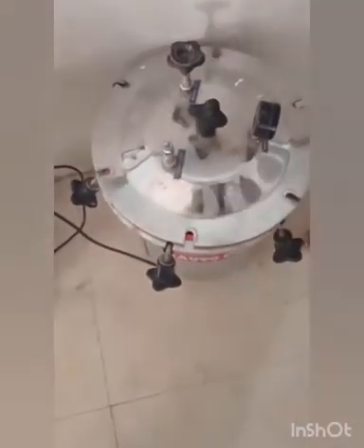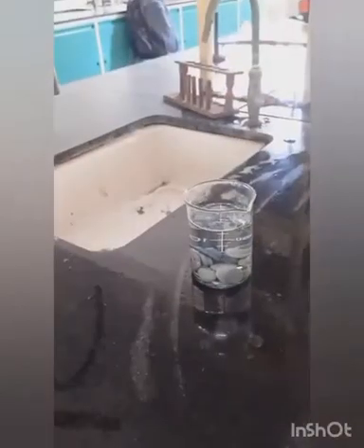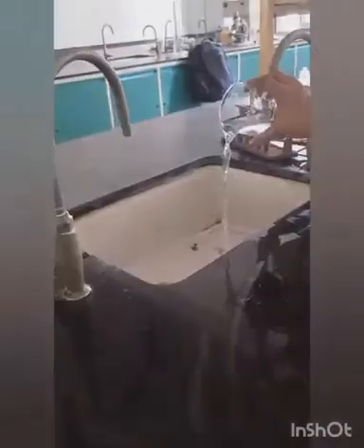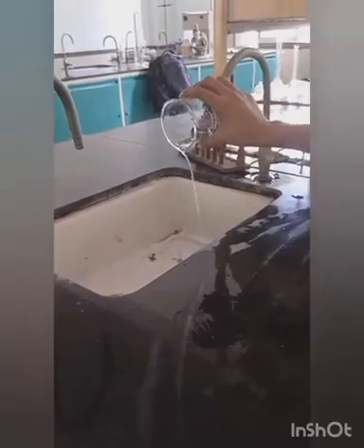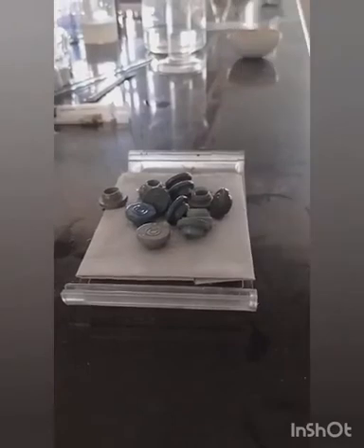Place the beaker in autoclave for 20 minutes for sterilization. After 20 minutes, maintain the temperature and remove the beaker from the autoclave. Remove the aluminium foil paper and separate the water from the closures. Place the closures on filter paper. These closures are now ready for testing.